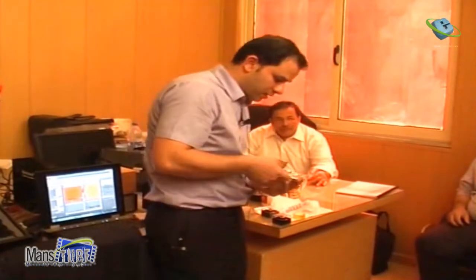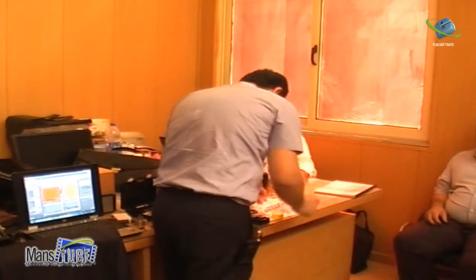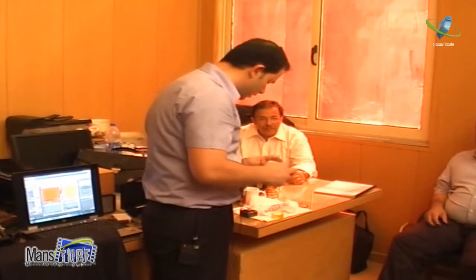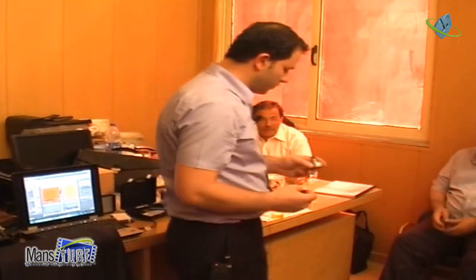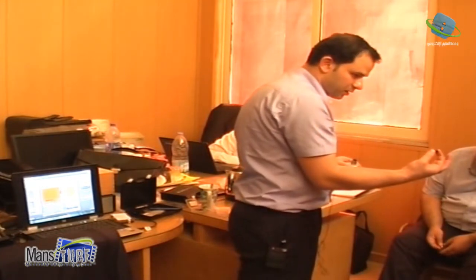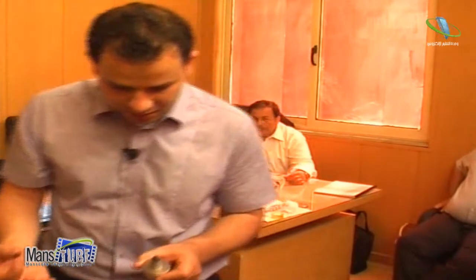Okay, and then I put, let's say, this is my sample here. Now first of all, I need the special sample holder for liquid. Compared to the other one, this is different. You see there is nothing inside this one, and this one has a transparent film, a plastic film, which is actually to avoid water going inside the scanner. This is the standard, with nothing inside, and this one has a transparent film.